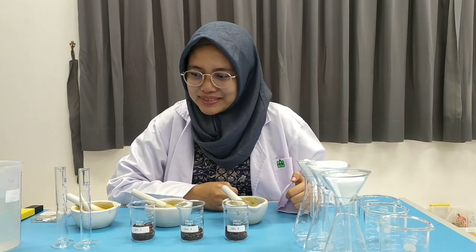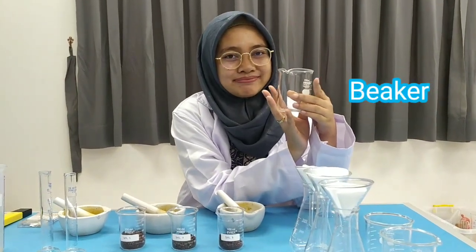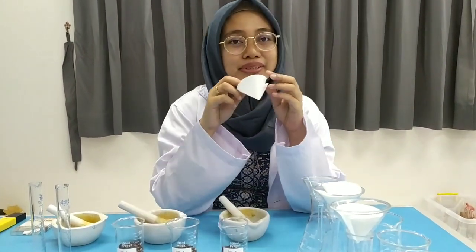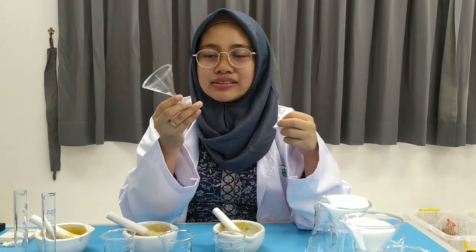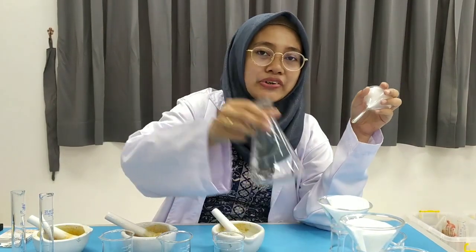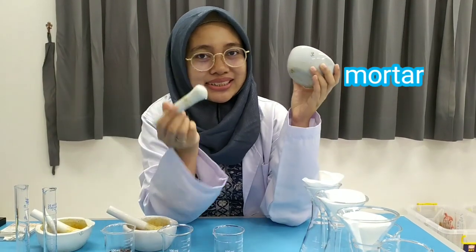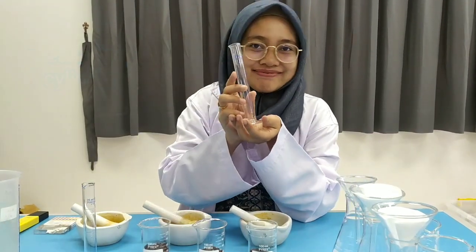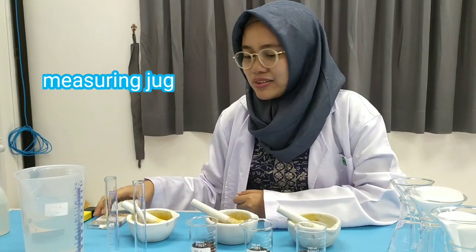We are using a lot of apparatus here. First, we have a beaker glass, and then we have filter paper which we will shape into a cone. After this, we have the funnel and also the conical flask. And then we have the mortar and also the pestle.